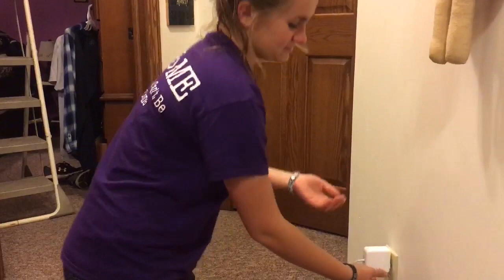Do you often get carpet burn and electrocute yourself by unplugging cords incorrectly? You can stay safe by keeping your hands dry and firmly grasping the plug.